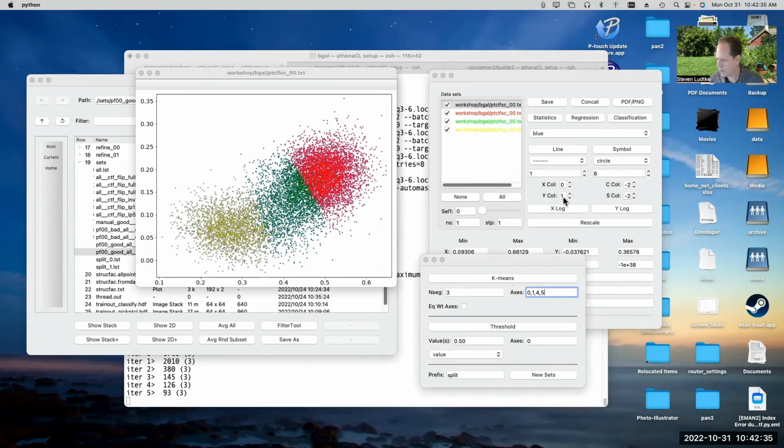So 0 and 1 are the lower resolution FSC values, which tend to be the most reliable. And 4 and 5 are also the lower resolution, but they're from the last iteration. So I want to look for things that are sort of self-consistent between the second to last iteration and the last iteration. And I want to look at the lower resolution FSCs, which are sort of the most predictive of things that are bad. So I'm trying to get rid of things like ice contamination or particles that are just really weak overall. And they'll tend to have a really low correlation at low resolution.